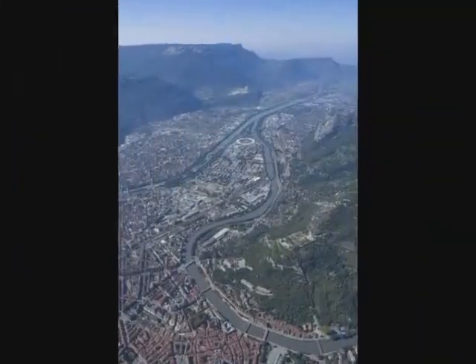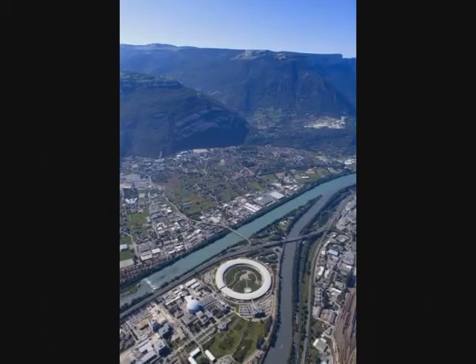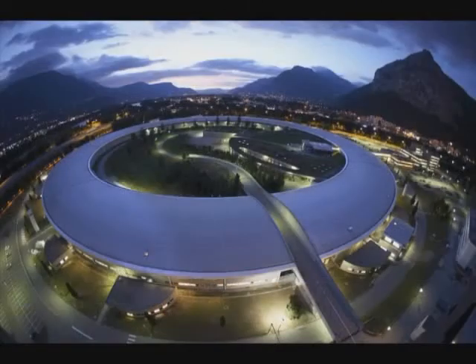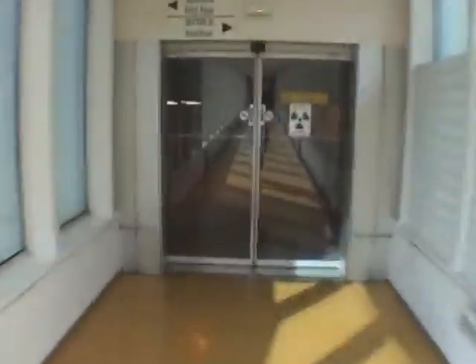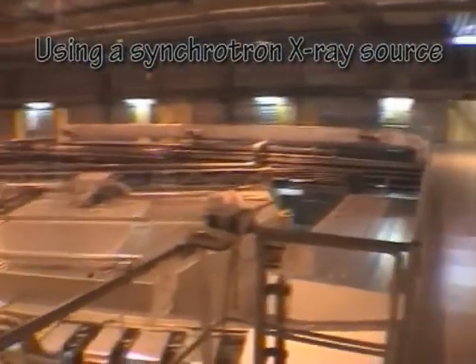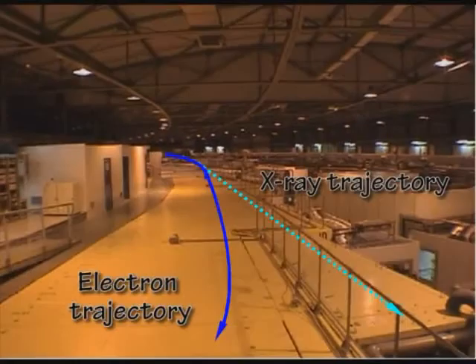The European synchrotron in Grenoble is one of the biggest and most powerful instruments in the world. Different types of rays, including the very intense X-rays which interest us, are produced by packets of electrons which circulate in the central ring.